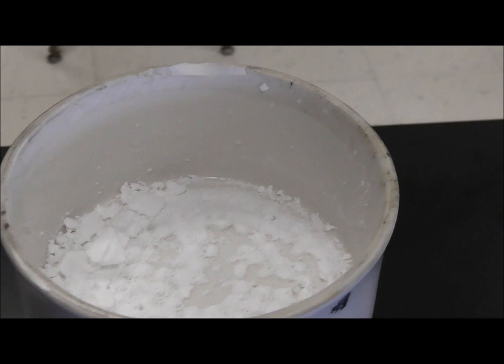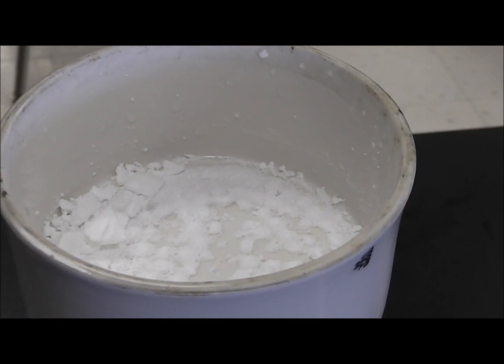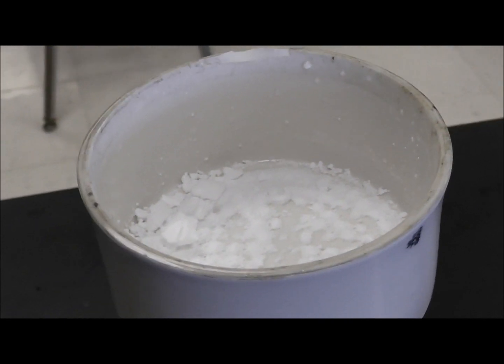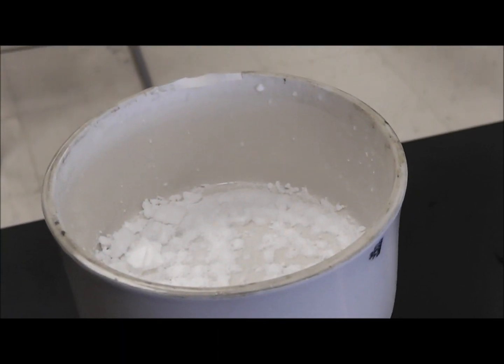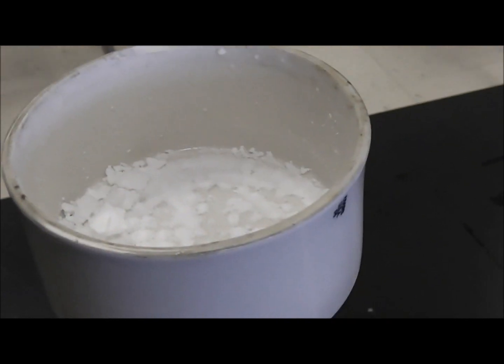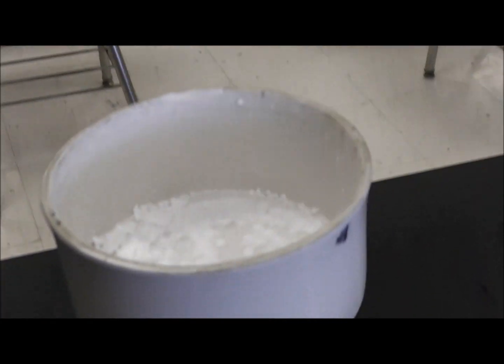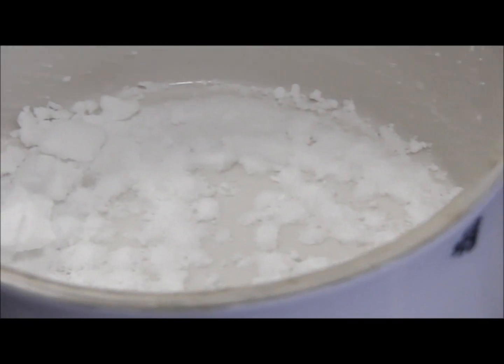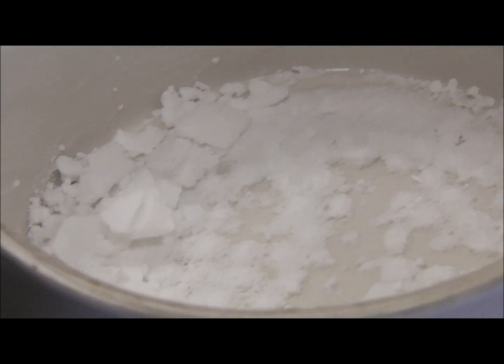We are going to dry it. And we are going to let it sit for a couple of days. And then we are going to reconstitute it into, we are going to purify it in all honesty. We are going to purify it. And when we purify it, after we purify it, we are going to test the purity of it and see if we did a good job in making our aspirin.